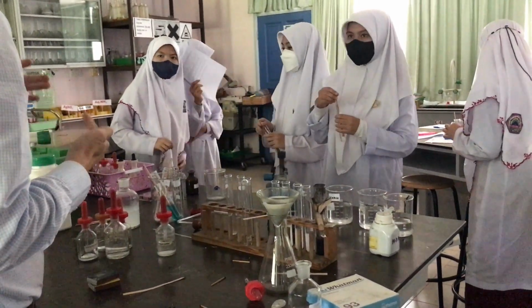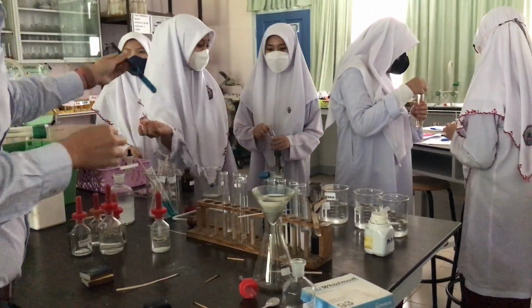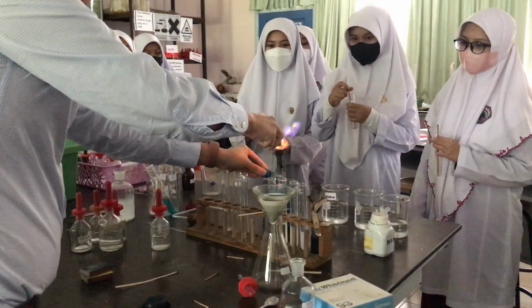Chlorine might not be some part today, yeah? But do you know the smell of Clorox? Yes. That is the smell of chlorine.